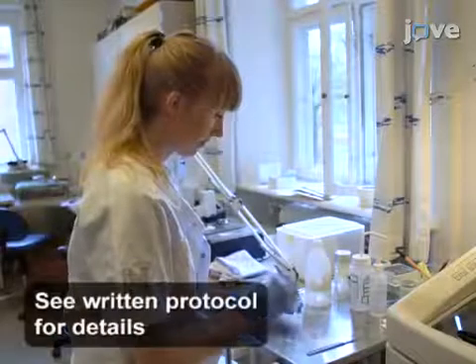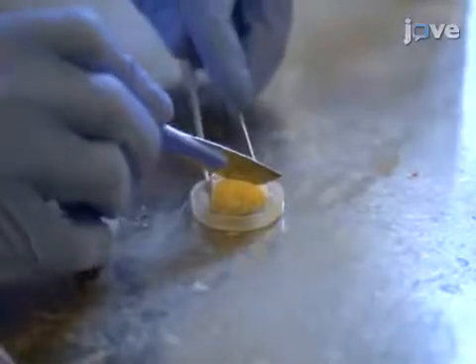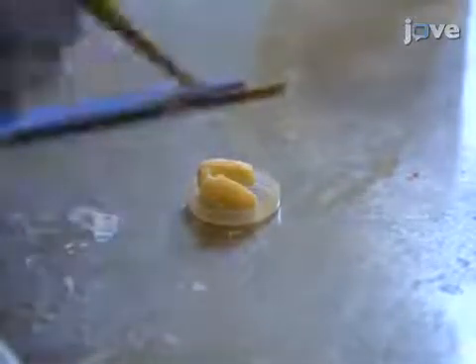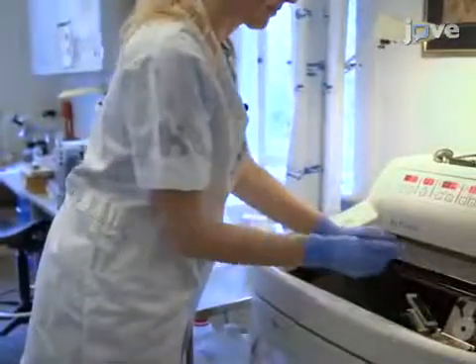Begin with a fixed and frozen rat brain. Using a scalpel, separate the right and left hemispheres along the midline of the brain, and then choose one or the other hemisphere randomly in the first brain. Thereafter, shift systematically between right and left hemisphere.